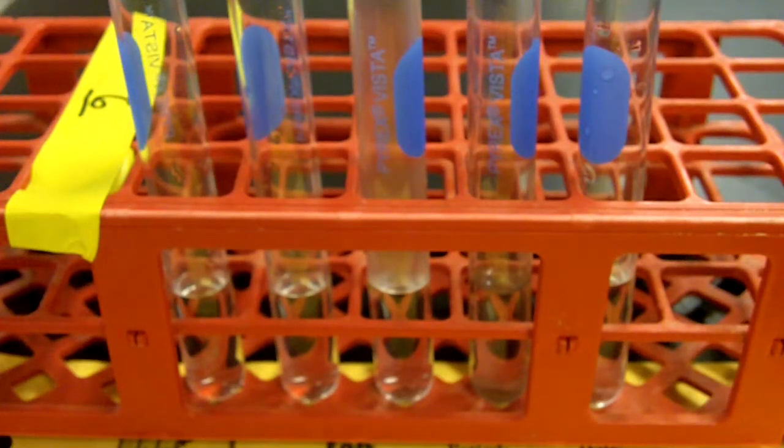In this investigation, you will observe how various metal samples undergo single displacement reactions when placed in an acid. If the metal is more active than the hydrogen in the acid, it will replace the hydrogen, and hydrogen gas will be released in the form of bubbles. Description of setup. You will have 5 test tubes set up on a rack, one for each metal sample. You will combine the hydrochloric acid with each metal and observe the results. The metal samples will be available at the front desk. Be sure to dispose of the metal samples properly at the conclusion of the lab.